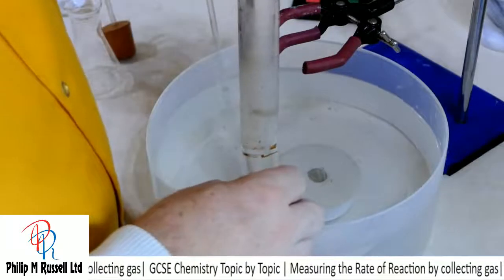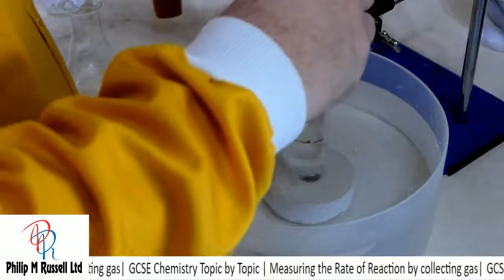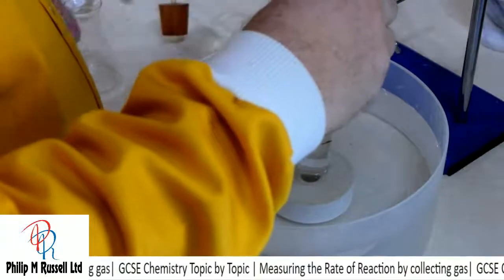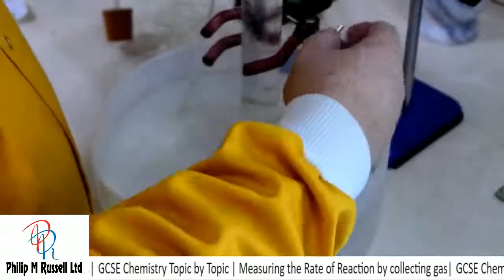And now I can pick this up and put this on top of our beehive shelf, and I can clamp it into place.